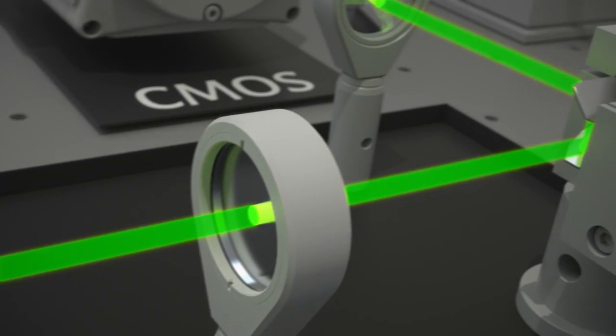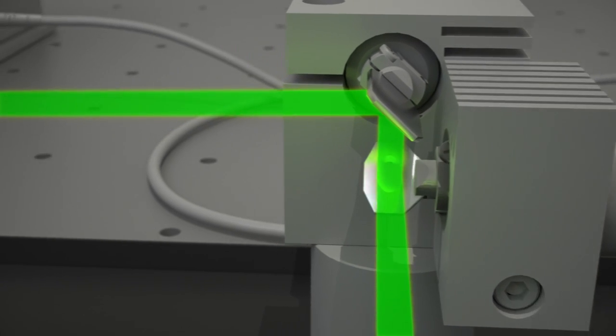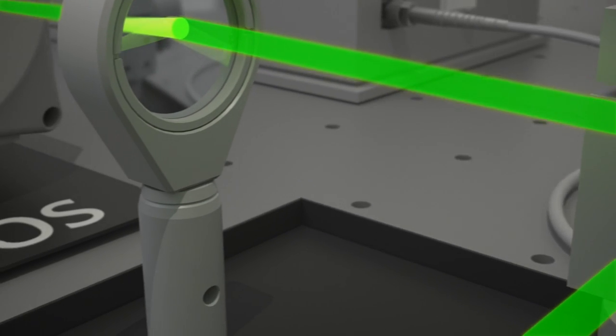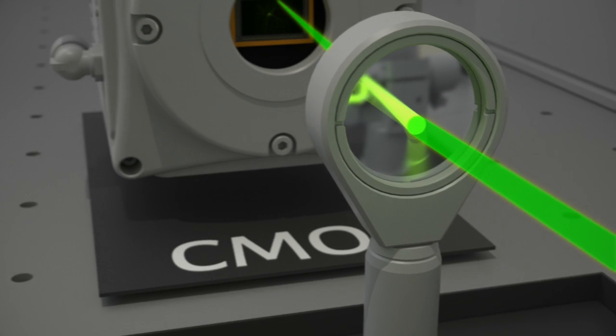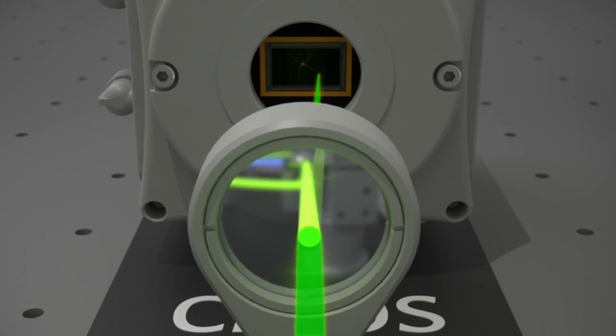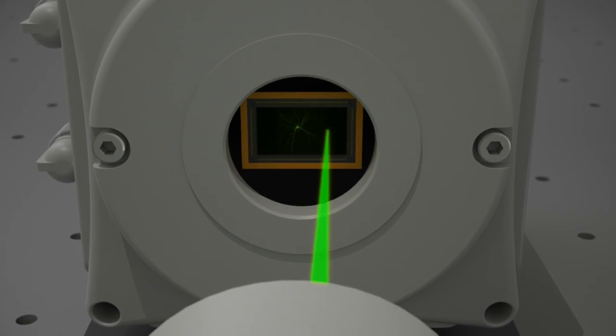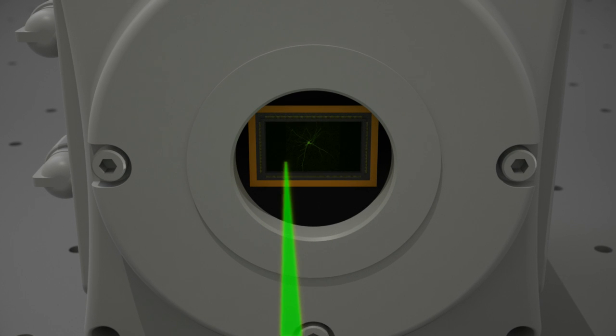The emission light is collimated again and hits the X and Y rescanning mirrors. The emission light is directed via the rescan scan lens to the camera chip. Here, the image of the object is written point by point in a scanning manner. The image of the emitted fluorescent light appears in the camera and can be stored in the computer.